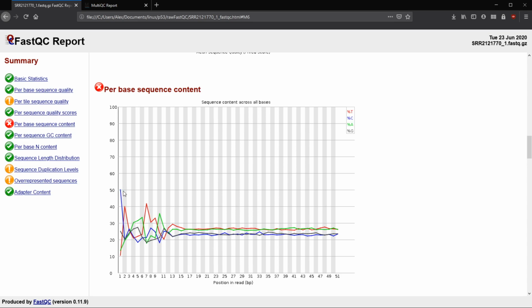So you can see here, we have a C way up here at 50% and a G here at 25, 26%. So since that's greater than a 10% difference, we have at least a warning, and a failure happens when that difference between the two bases is greater than 20%. So here, this is probably one of the locations where we're getting this failure. So if we have an A and T, it's not bad. Here is probably also another location where we're getting a fail, because the A is down at 18 something percent and the T is way up here at 40 some percent. So greater than 20, we have this failure.